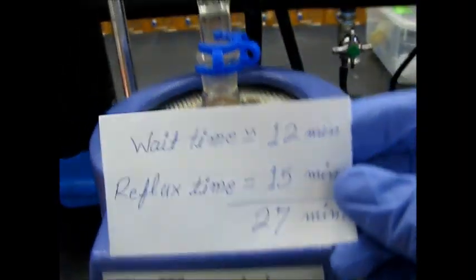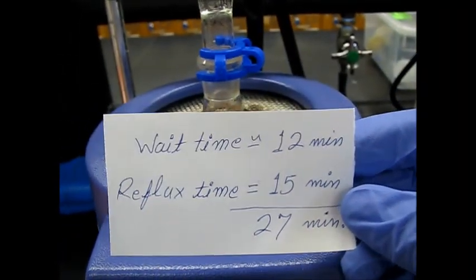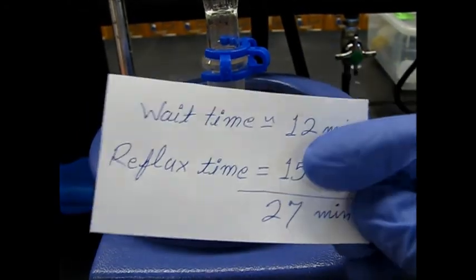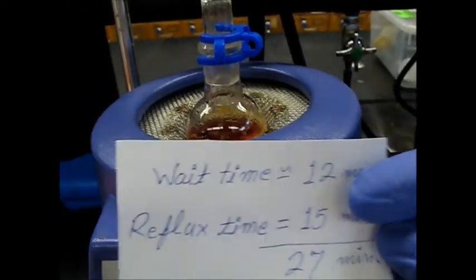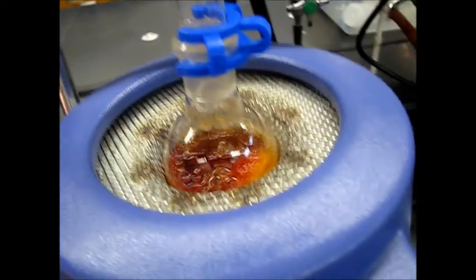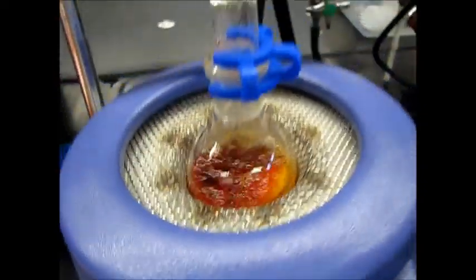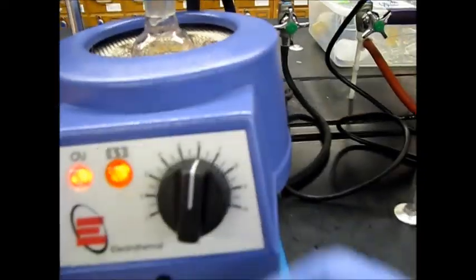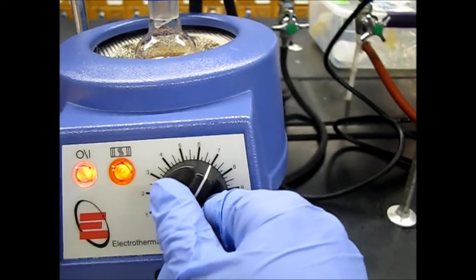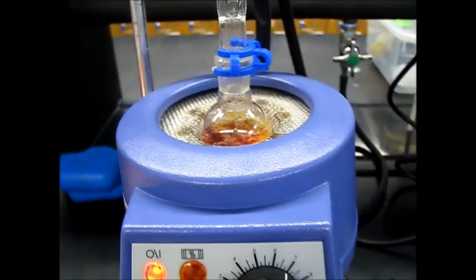So this is here after 15 minutes refluxing. We waited for 12 minutes and 15 minutes for refluxing, now 27 minutes. So here you can see still some solid is there. So probably we need to increase the heat a little bit more so that we can dissolve this. And maybe 5 minutes more.